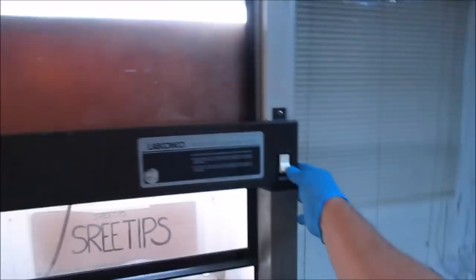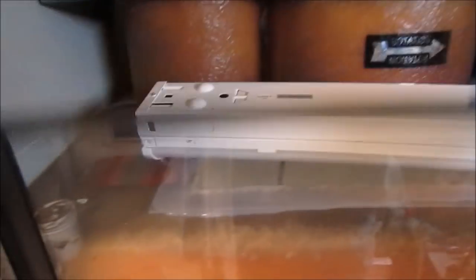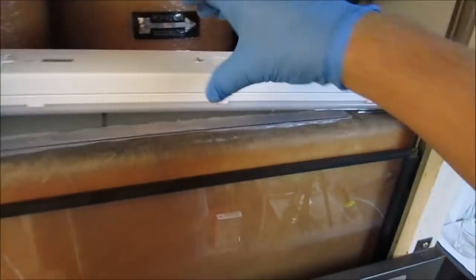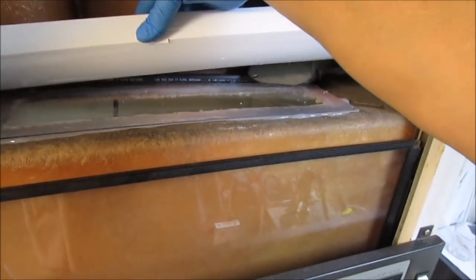What I'm going to do is go ahead and take this cover down and just show you here what I got. I've got it wired to the switch so I can hit the switch and the light goes on. It's just an LED strip that I bought at Ace Hardware. I know I sound like I'm an advertisement for Ace, but they got a lot of good stuff and they're real close to my house, so it might cost a few pennies more for their products, but they're convenient and close by.